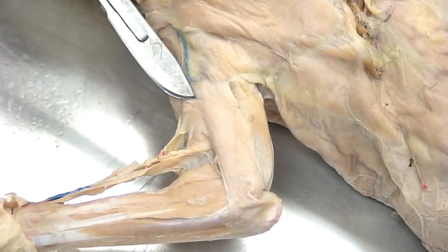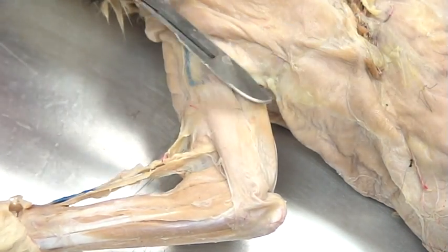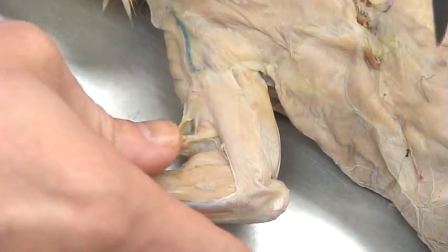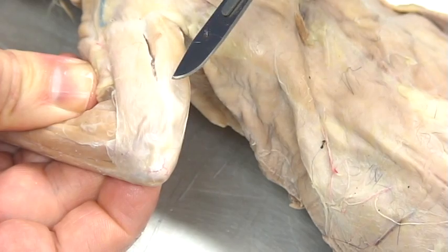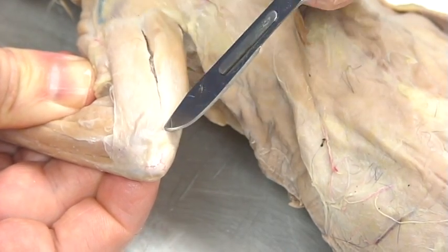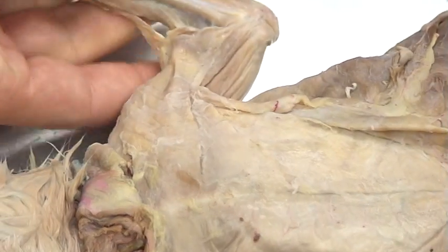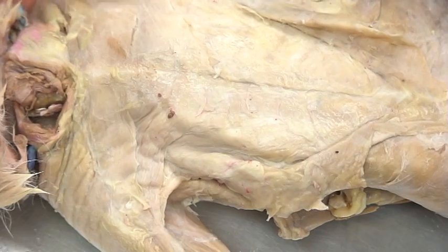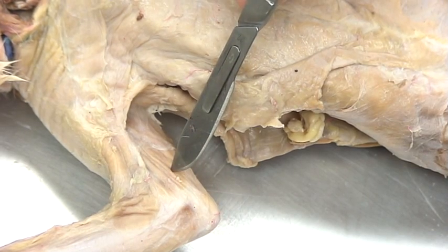Now we're going to take a look at the upper arm first, both the lateral side as well as the medial side. The dorsal is up right now — we're looking at the lateral side of the arm. Here's the triceps muscle, and it's called triceps because it has three heads. It's got one right here. Here's the lateral head, here's the more posterior head, and if I flip the cat over, we're also going to see a medial head.